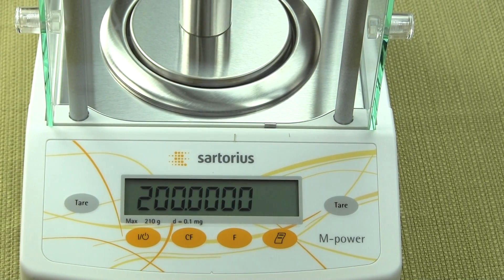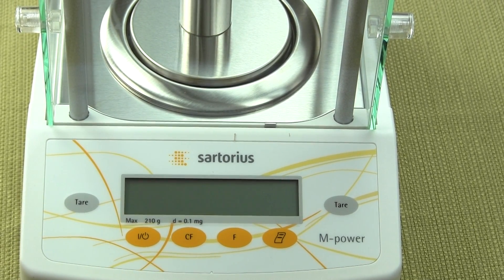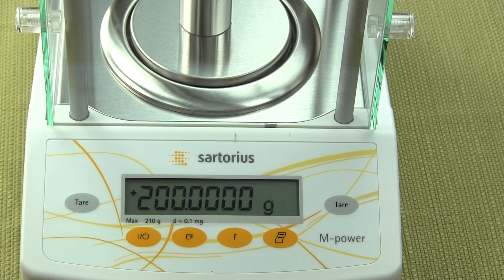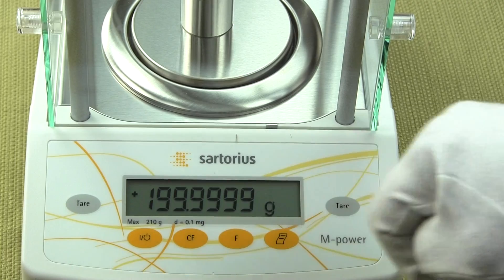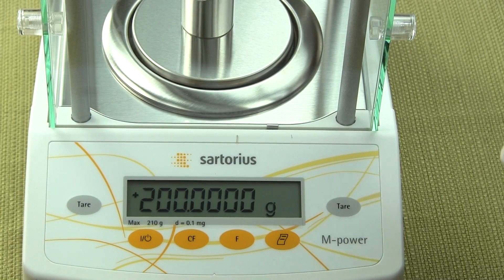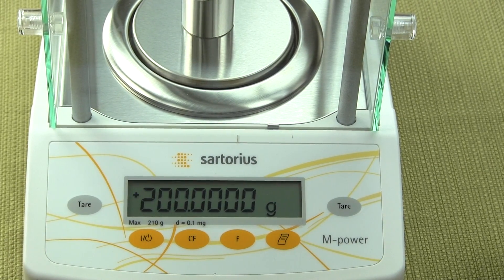And the balance will beep. There was a beep, you probably couldn't hear it. But once the calibration is complete, the balance has been calibrated. Calibration is extremely simple.